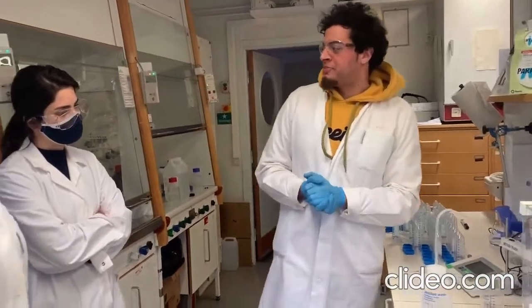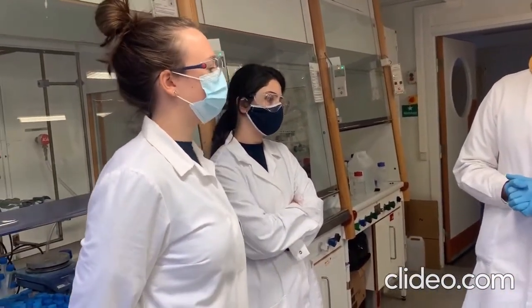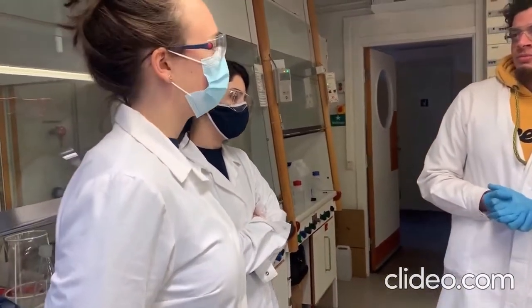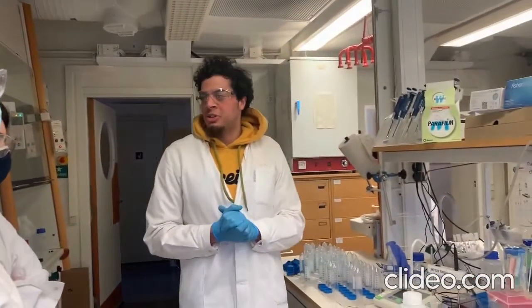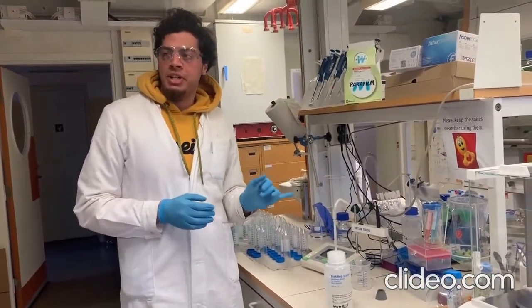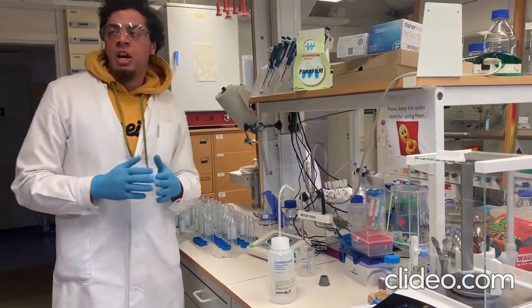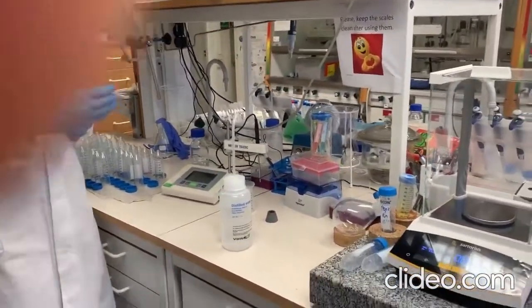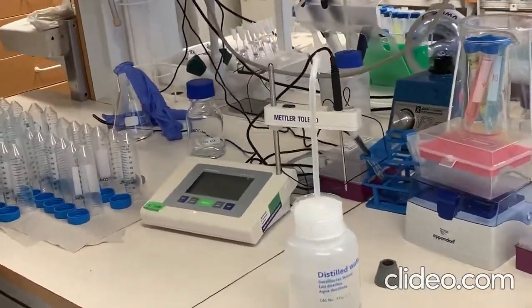Any questions? Yeah, I do have a question. Yeah, please. So, how often do you have to calibrate this pH meter? Do you have to do it every time you measure, or once in a while? Yeah, that's a very good question. Actually, you need to do the calibration each time you do a measurement. So at the beginning of each day, or when you are planning to do an experiment, it is much better and highly recommended to do the calibration to make sure you have an accurate measurement.